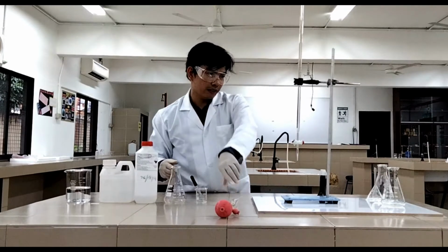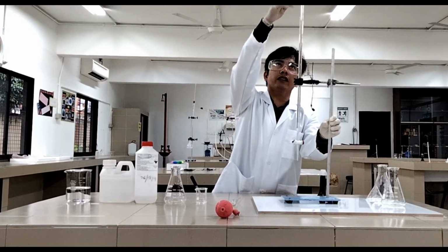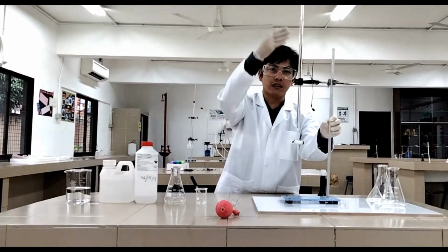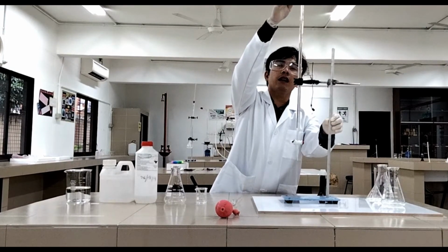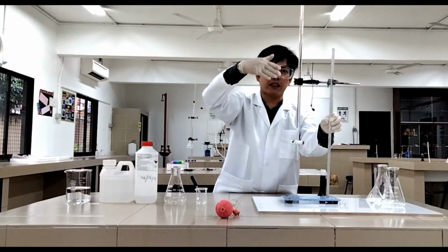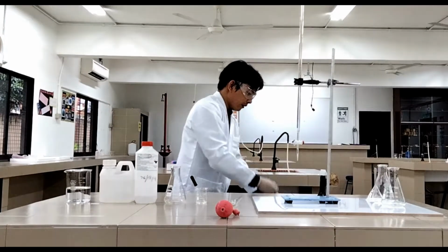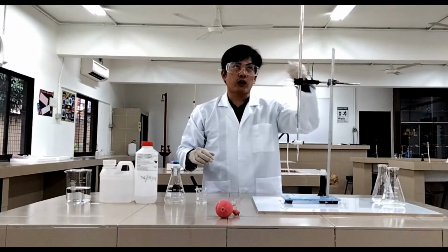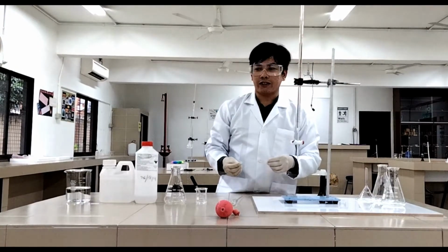The next is the burette. This burette is the container, this is where we're going to put the sodium hydroxide. Earlier, I already put the sodium hydroxide inside. The 1 molar sodium hydroxide. You cannot just simply transfer it above. So what I did was, I put it on the floor and then transferred it using a funnel. So you are not going to transfer it up this high because it's very dangerous.